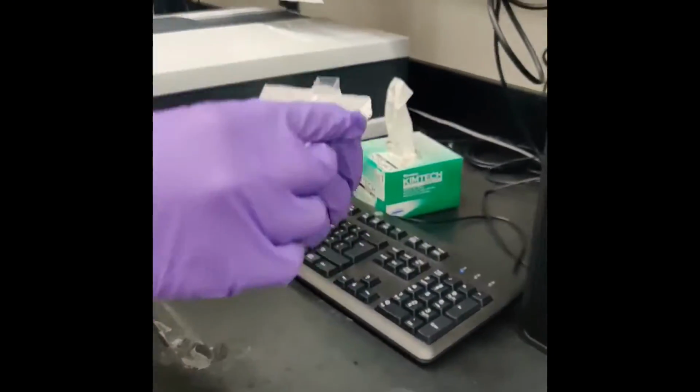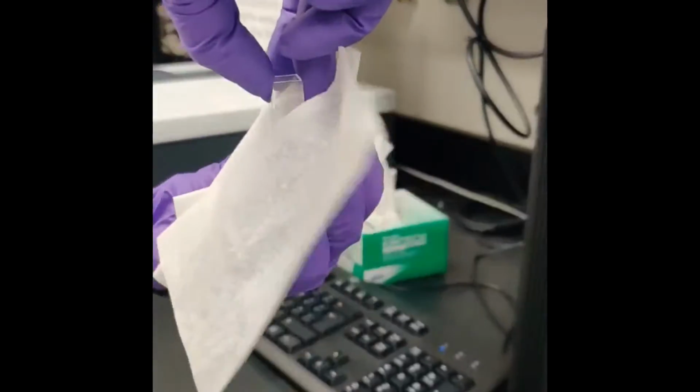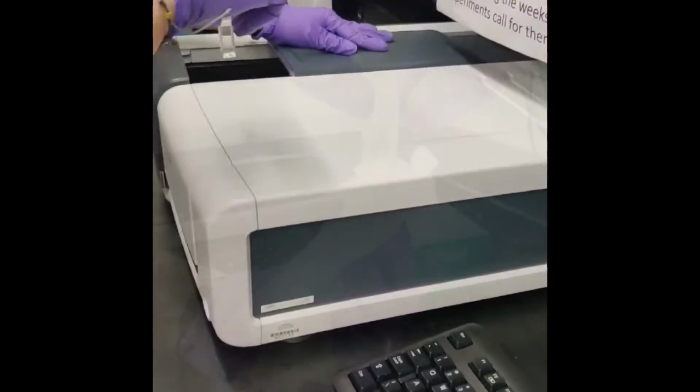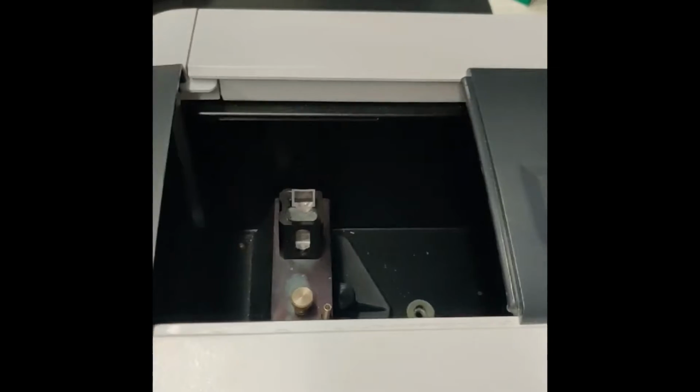In the spectrophotometer room, we found the lambda max, which was 611, and zeroed it with a cuvette filled with water. After zeroing it, we inserted our first dilution and scanned for absorption, and repeated this process with all dilutions.